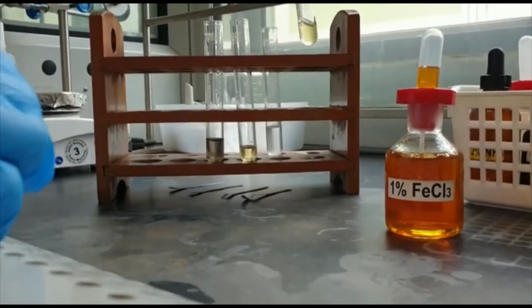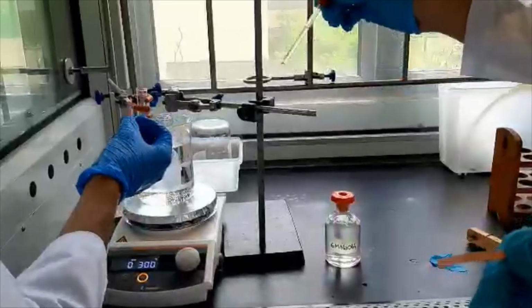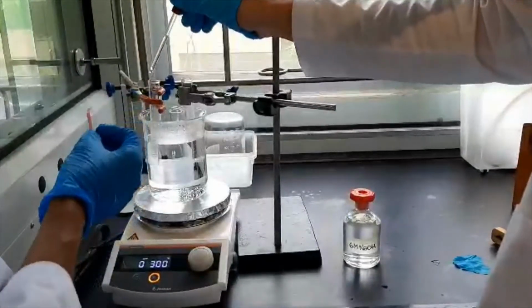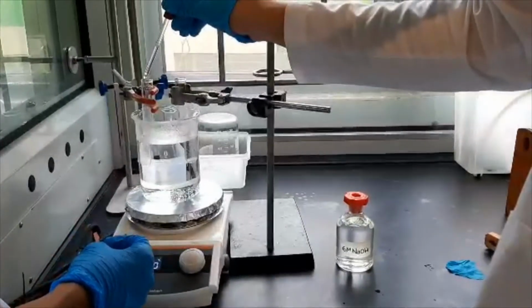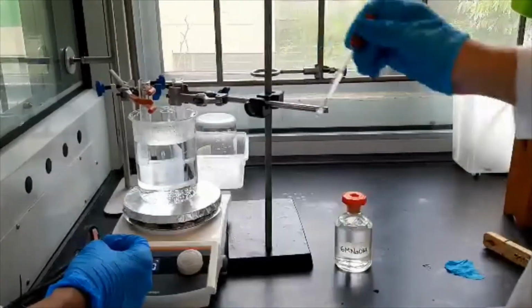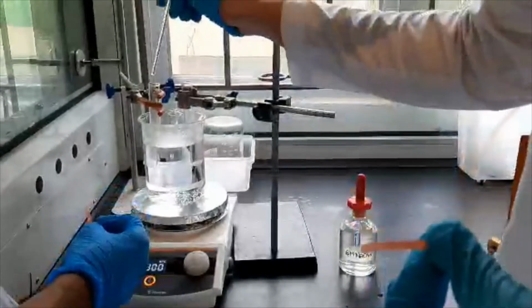Now we have 2 unidentified drugs left. Jonathan and May prepared new samples of the drugs by adding the drugs once again to 2 new test tubes by adding DI water to dissolve. Here, Jonathan sets up the following apparatus as such: filling the beaker with water, then clamping the test tubes to retort stands, and submerging half the tubes in the water. Let the heating begin.